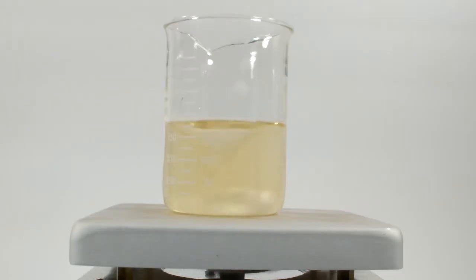Now that I have it spinning freely again, I dump in 22.8 grams of tribasic sodium phosphate, also called trisodium phosphate, and watch it seize up again. The final product is supposed to have a gel-like, almost toothpaste consistency.